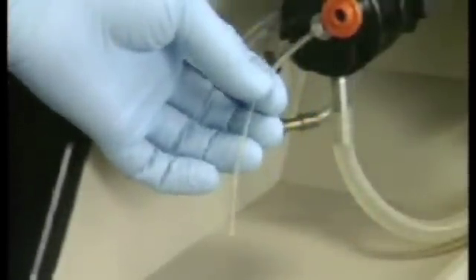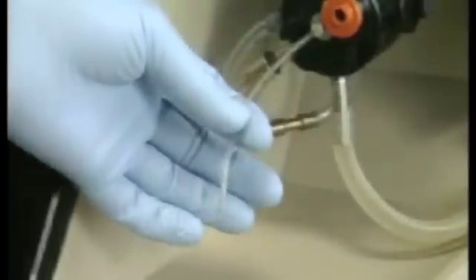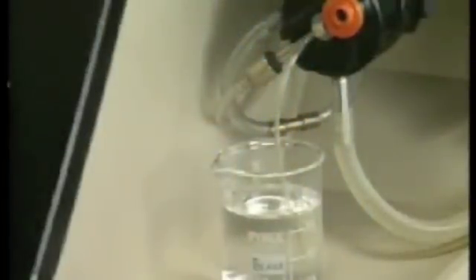Once this is done, the settings of the instrument should not be altered until the analysis is completed. Aspirate the blank solution to clean the nebulizer. Then aspirate the next standard solution. Note the meter reading. Remove the standard solution and aspirate the blank solution again. Continue with this procedure until readings have been recorded for all the standard solutions.